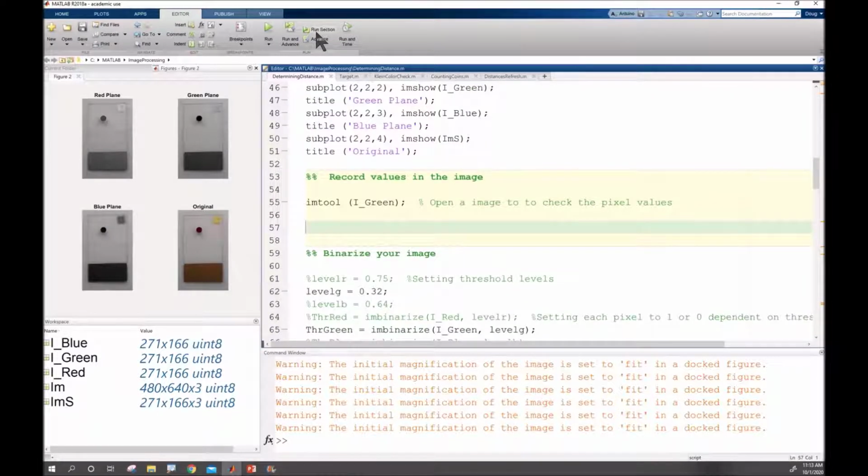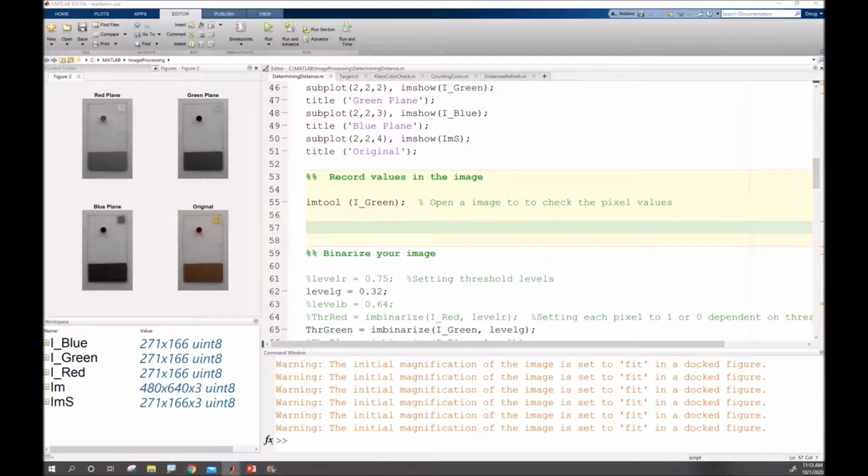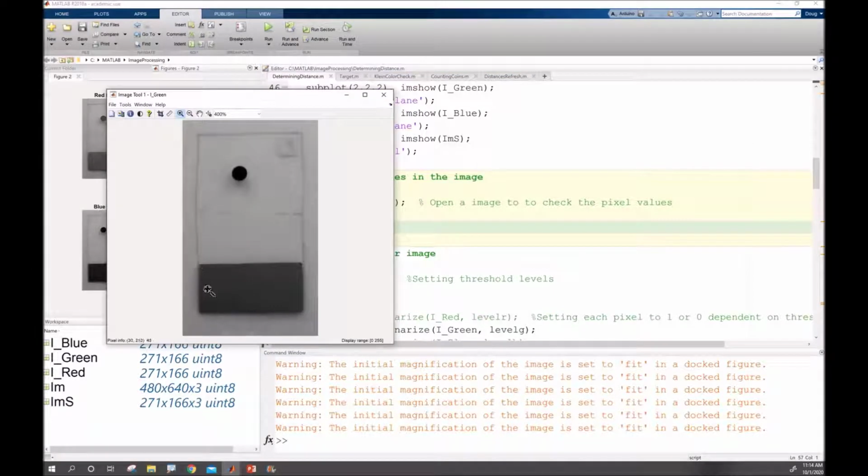I'm going to run this on just my green, so my image tool there, and I can see the pixel location and also the intensity. In other words, to what level is it green or what level is it not.